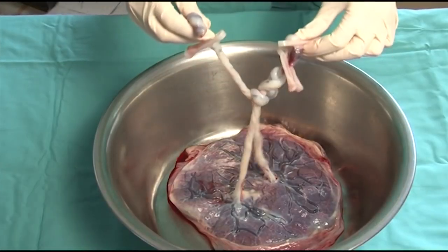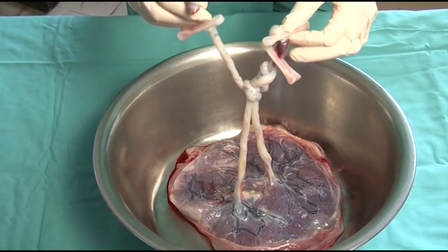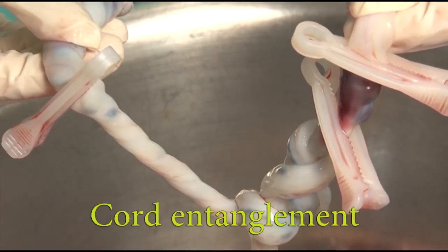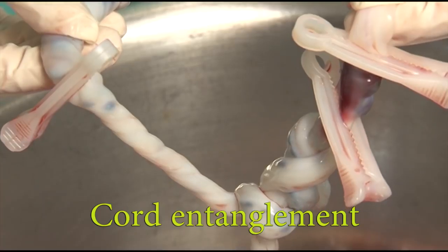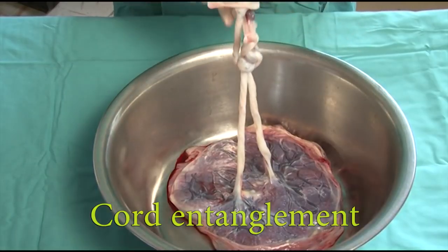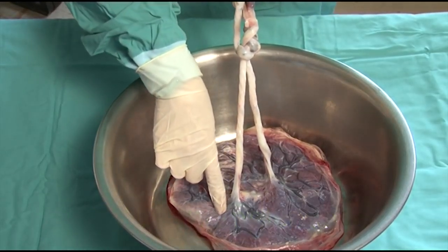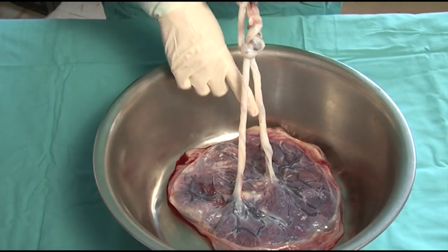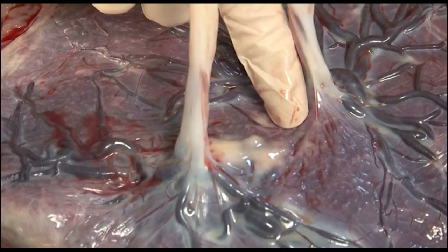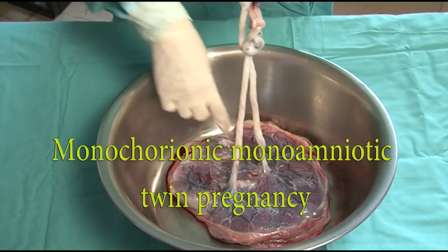In this twin pregnancy, there is only one placenta with two umbilical cords, which show multiple knots with cord entanglement. This is only possible if both twins share one amniotic sac. Following the cords down to their insertion points into the common placenta, it becomes noticeable that there are no dividing membranes present, indicating a case of monochorionic monoamniotic twin pregnancy.